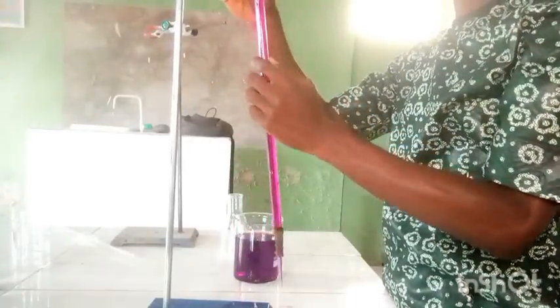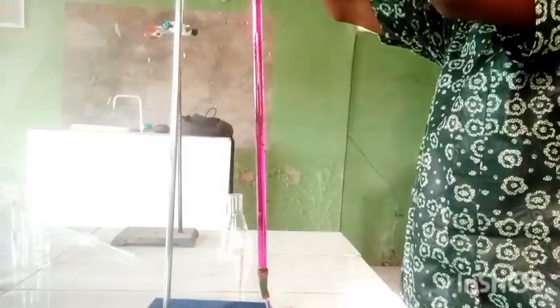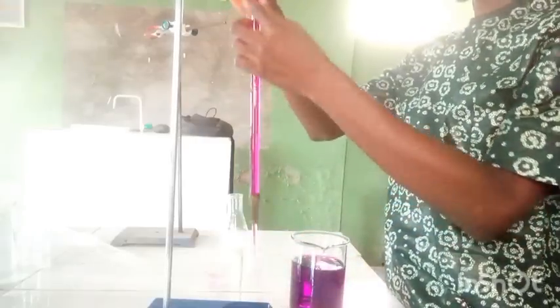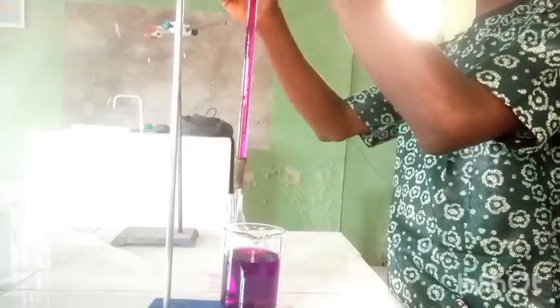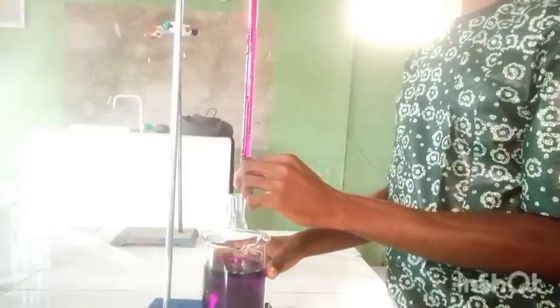I have filled solution A into the burette using a funnel to fill it completely. I adjust the volume and fill it to the required level. I am using a ball bearing here — the ball bearing is easier to use than a pin. I have set the burette to zero, and now I will use the pipette to draw 25cm³ of solution B.